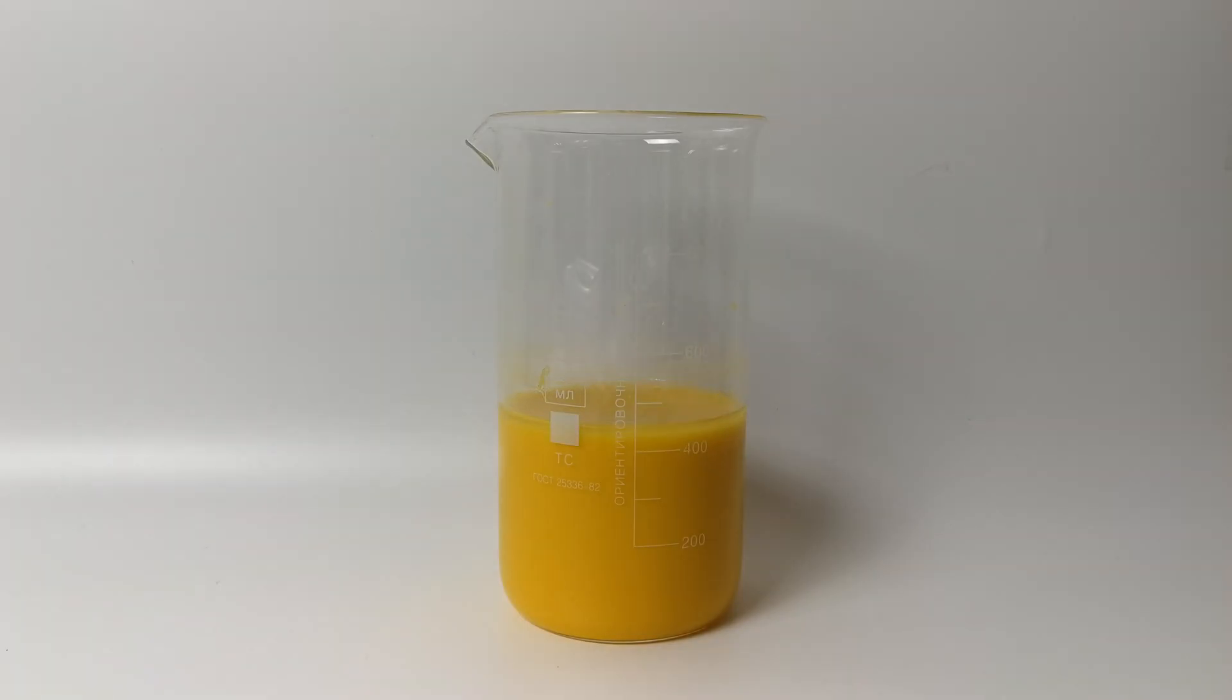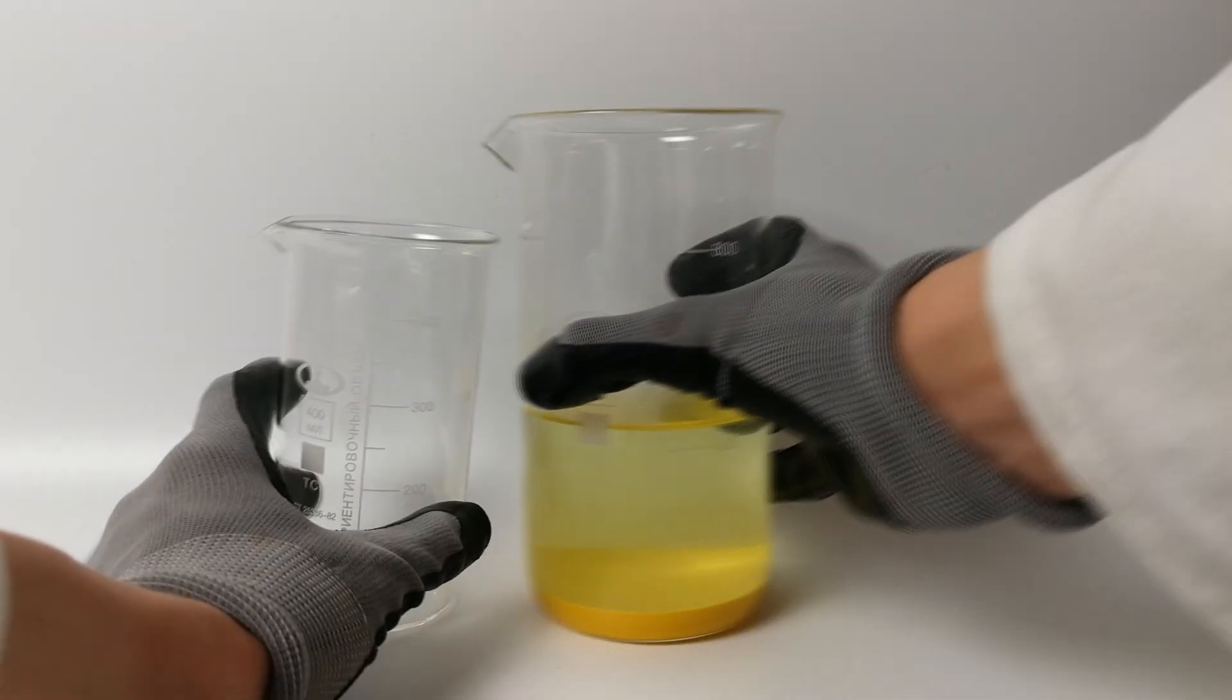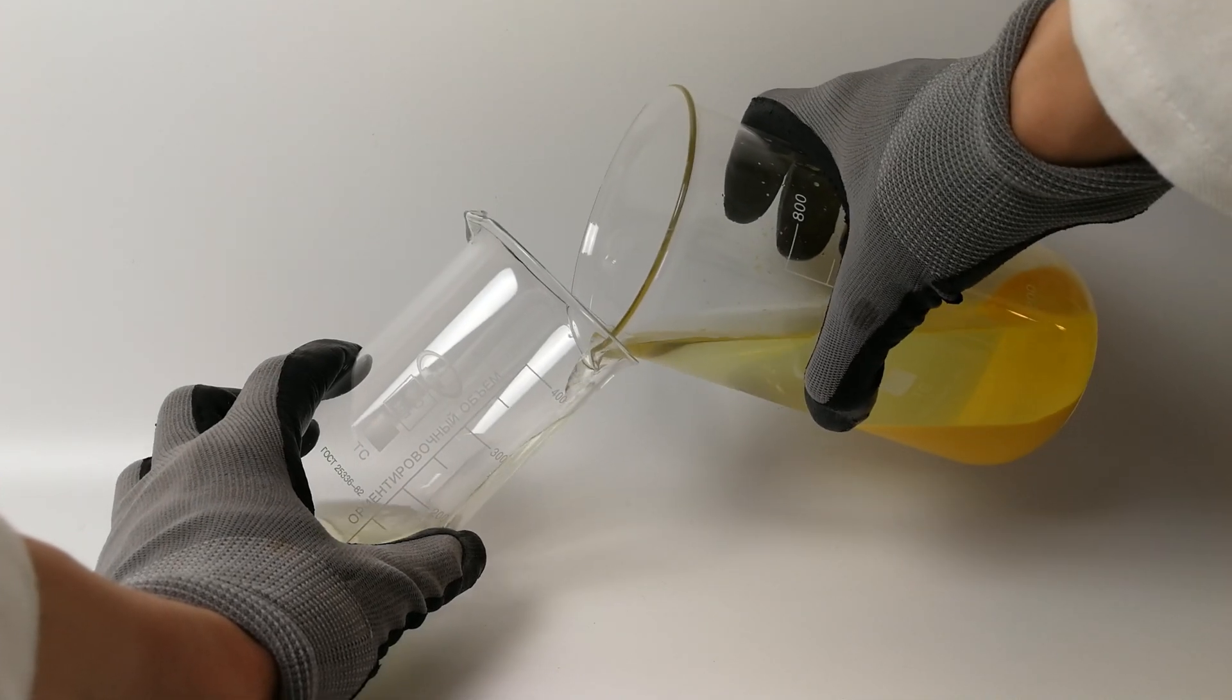Since I'm filtering under a vacuum, one washing is enough for me. Once the precipitate settles, we can decant the water.